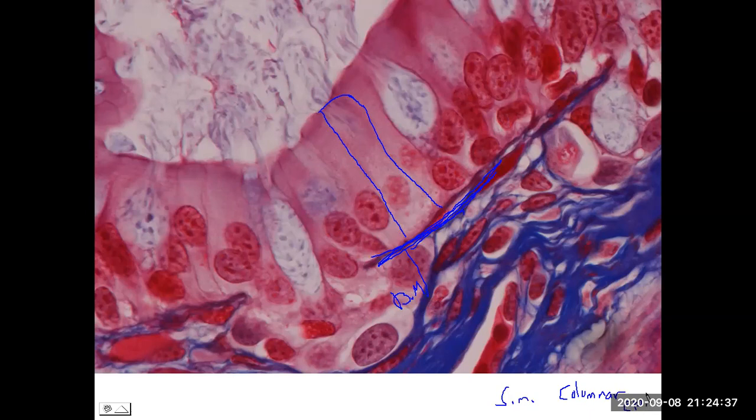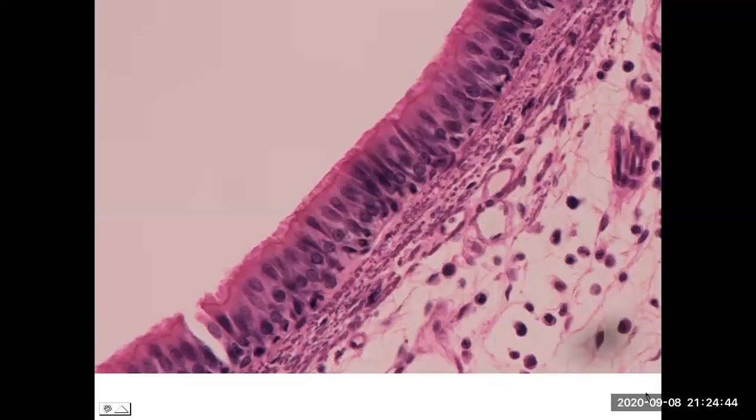So we had 3 examples of simple. Moving forward with the lab now, we have what's called pseudostratified ciliated columnar epithelium. So pseudostratified ciliated columnar epithelium. And of course, we would spell that out. So that's what we see right here. We could put a bracket on it, all of that PSCCE.